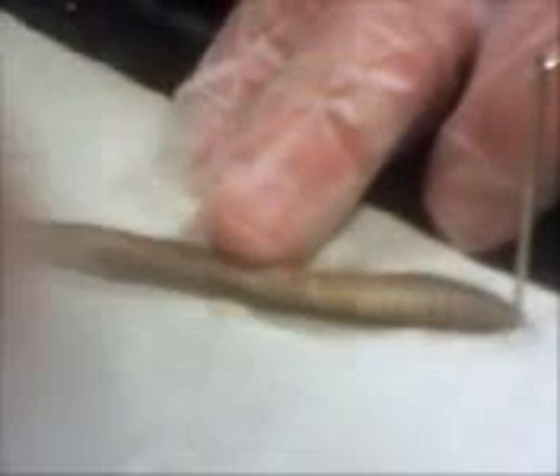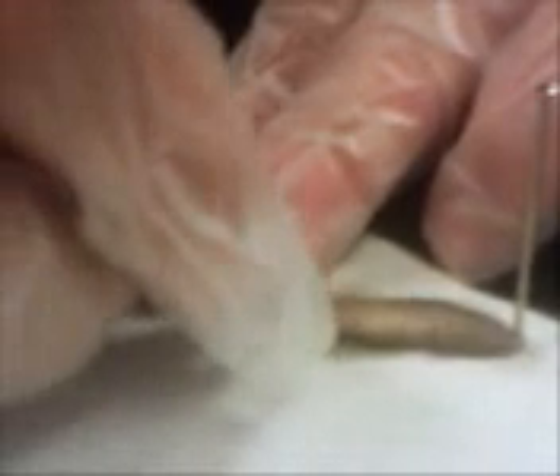I'm recording it all. I like the noises. Eww. Look at those tissues coming in. Eww. I didn't cut right there. What's it called? Digestive system.